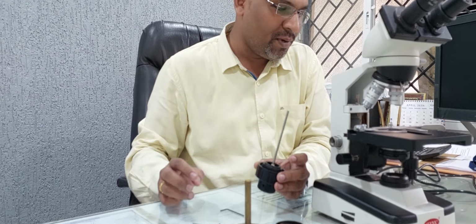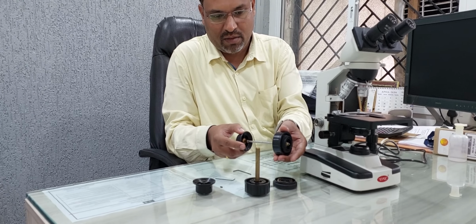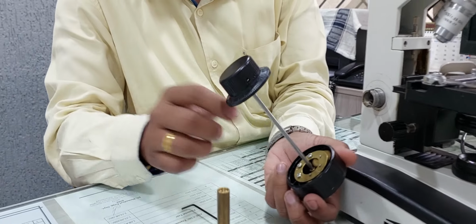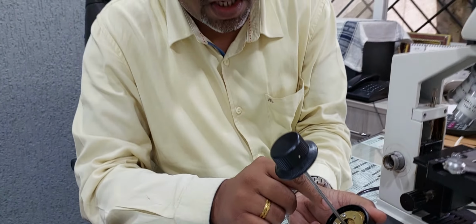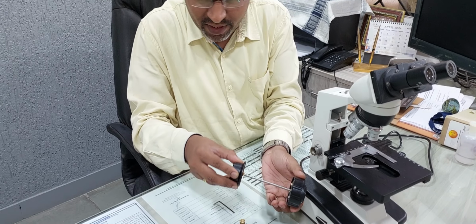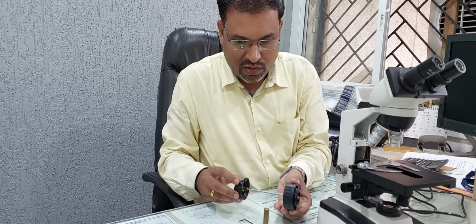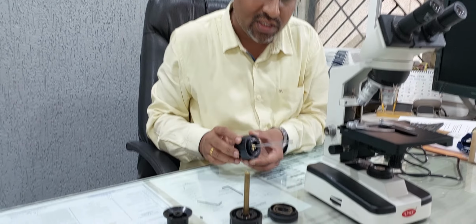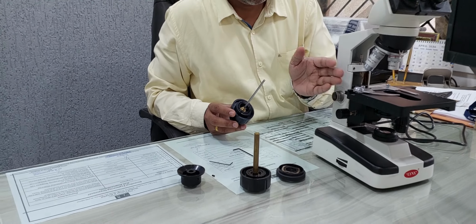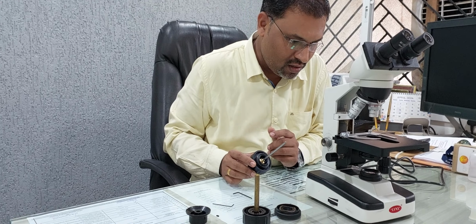Now that it is open, I will show you what exactly the assembly inside looks like. Come close. These are the different gears for the movement of the stage and fine adjustment. This gear assembly is stuck here and rotates, right? So you have to just replace this washer and fix it again properly, and your stage movement and fine adjustment will be sorted out.